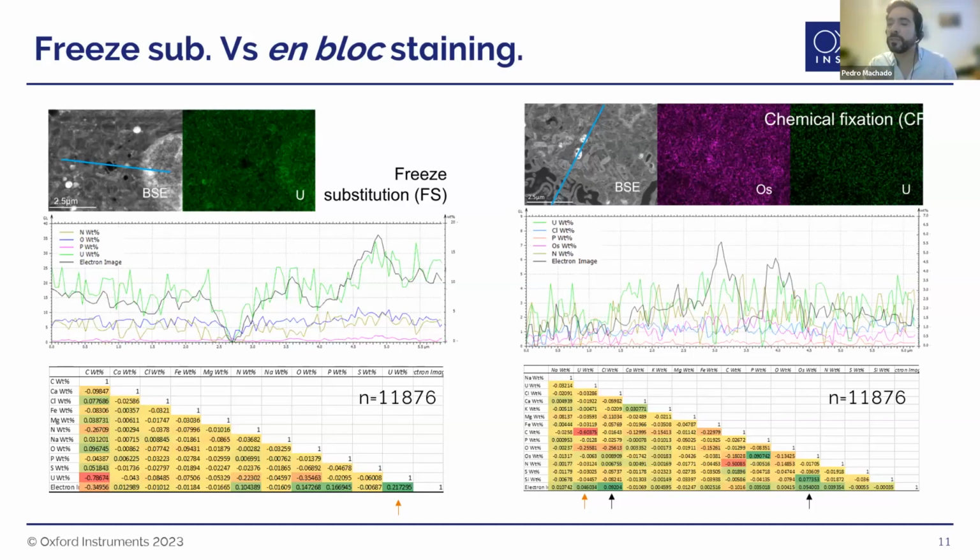But we start to see also a positive correlation with chlorine. And we suspect this actually comes from the primary fixation, where you have all these ions in your fixative, and they actually contribute in a sense to give some more contrast to your sample when you're imaging, which is interesting. And how can you play with the primary fix to enhance the staining of your sample?